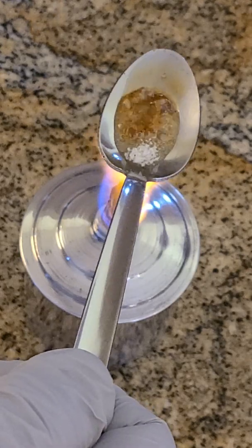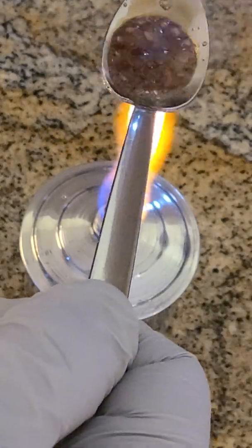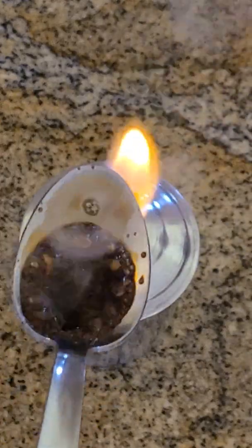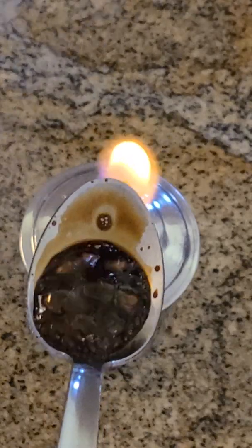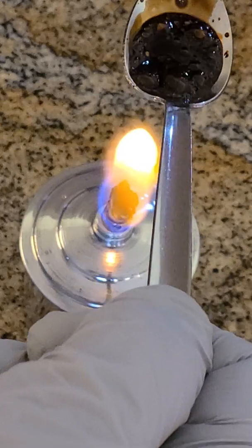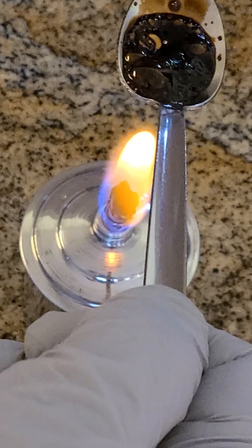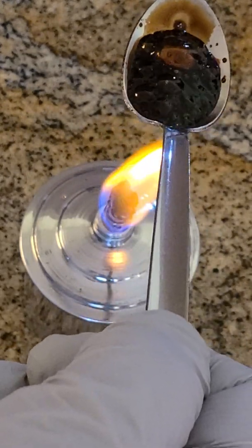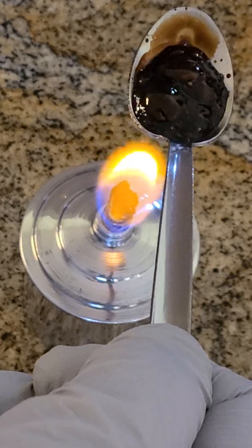Really cool thing is if you ever boil Coke, you'll be left with sugar basically. But you can see it's really smoking — that's evidence of the reaction. It's turning really dark. I'm going to move it away from the flame, just because I don't want to set off my smoke detector, but I can see the sugar there. As it slowly cools down, you can set it back, and it will eventually completely combust. In this room there's plenty of oxygen, so the limiting reactant is the sucrose. It's caramelizing, and that black gunk is basically carbon.